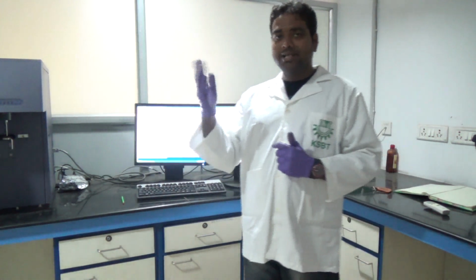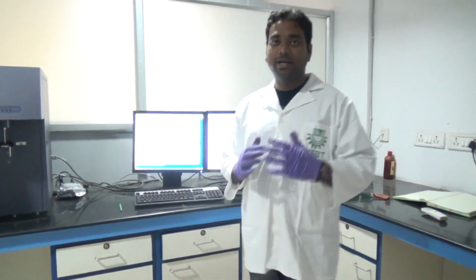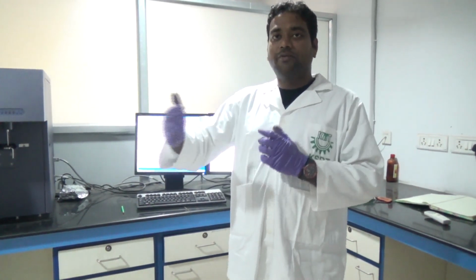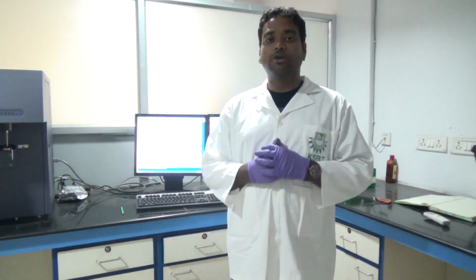For example, cell cycle analysis we can also do. Our cell cycle has phases G1, S, G2/M and G0. We can calculate what percentage of DNA is in G1 phase, G2 phase, S phase. So we will make different gates, and the different gates will give us the different stages of DNA. We can check ROS, chromosome, apoptosis, necrosis. Apoptosis and necrosis we can also check.